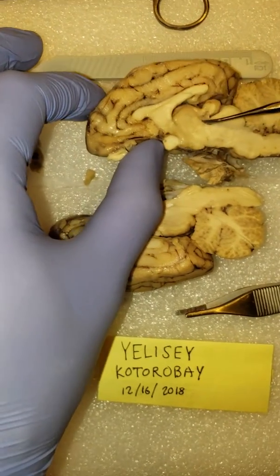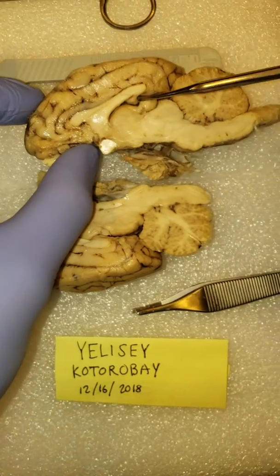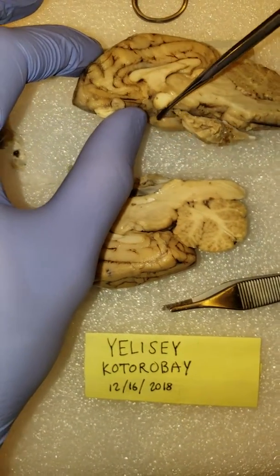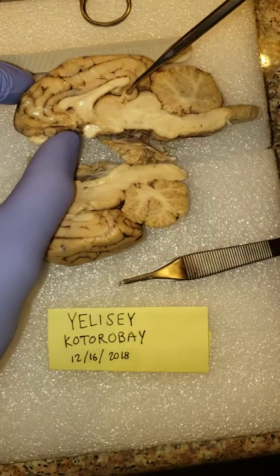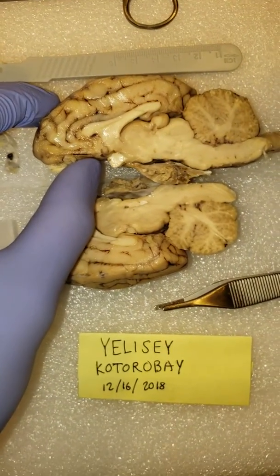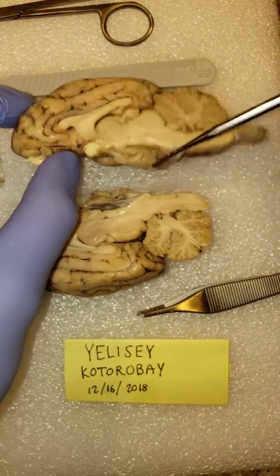You can't really tell apart the glands and stuff. This might actually be a gland. Not the pituitary, but the pineal gland. The pituitary is going to be a little bit towards behind the frontal lobes, more or less. This might actually be it. It's really hard to say. Not everything's colored and labeled like in the textbooks. Beyond that, that should, I believe, be it.